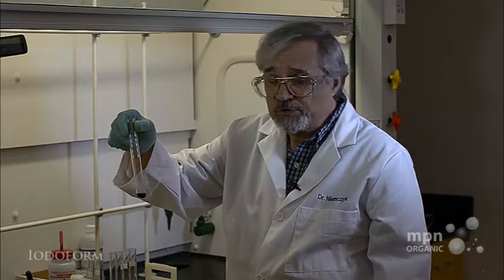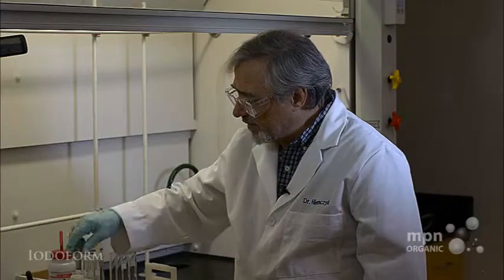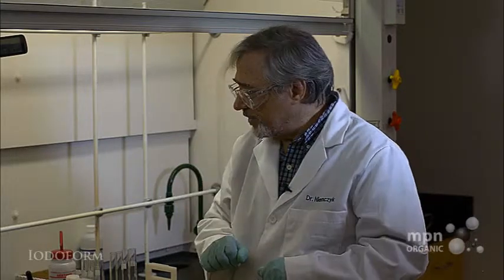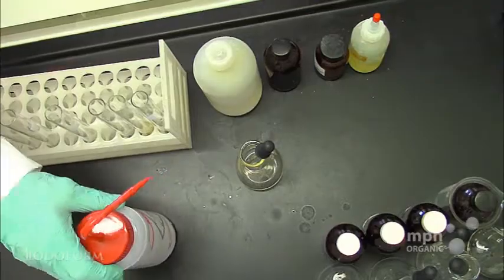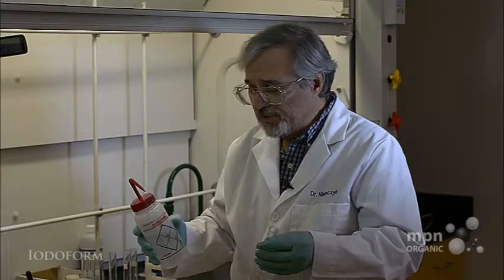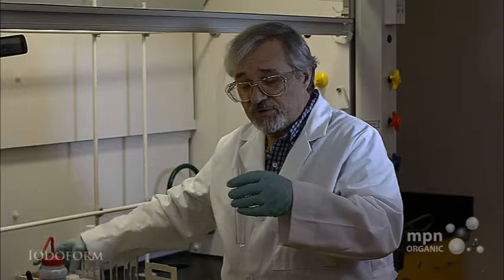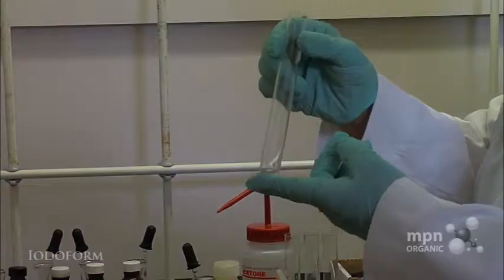So that's what we're going to be using for our iodine supply. The other part of the test involves 3 molar sodium hydroxide, so make sure that you have your safety gloves on when you do this test. What I'm going to use is the ultimate methyl ketone, which is acetone, and we'll just put a little bit in there. Acetone is dimethyl ketone, so this has a chance to work on either side of the carbon-oxygen double bond.